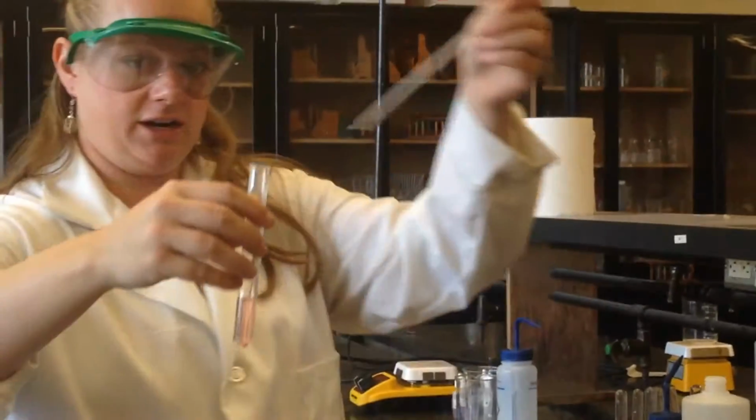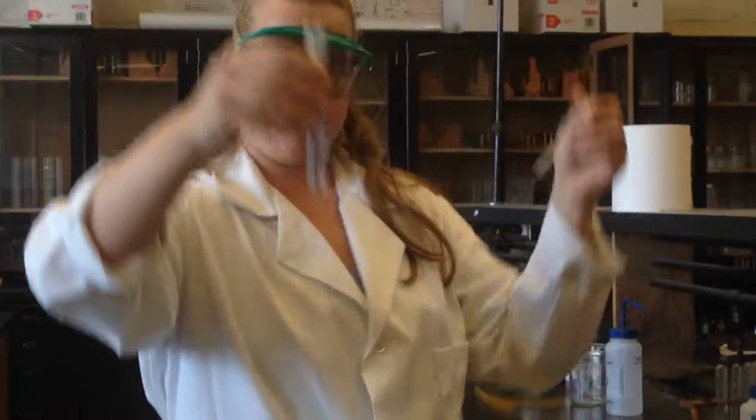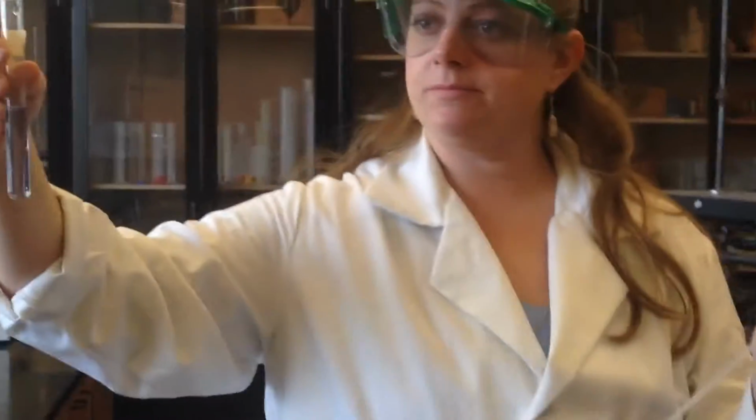Ooh, see, oh my gosh. Is it turning color? It's getting hot. Oh, and it's back to blue. Back to blue. Back to purple. So purple would be what? Between red and blue. So that would be at equilibrium.